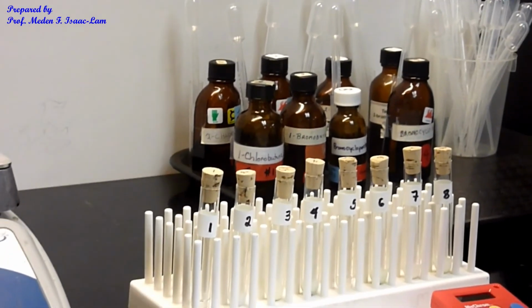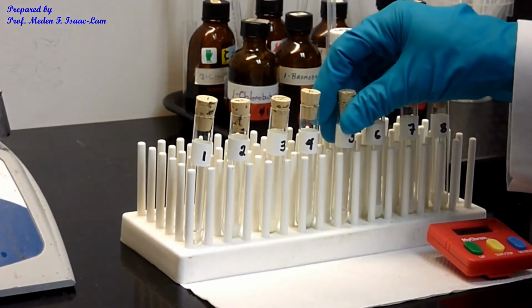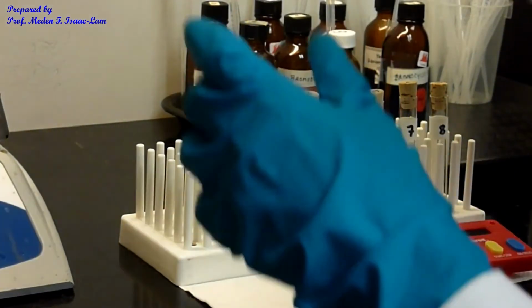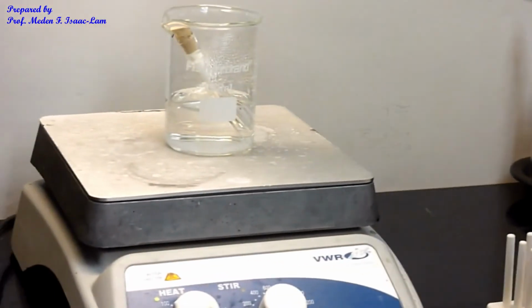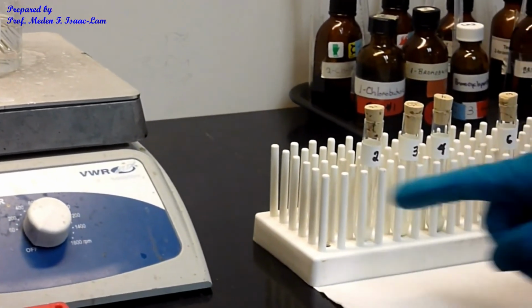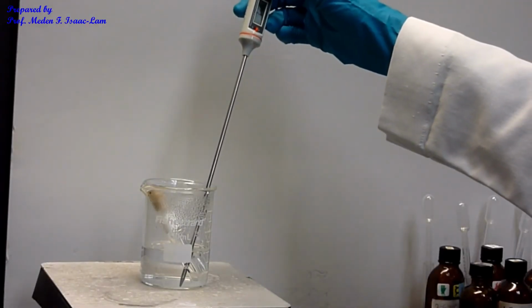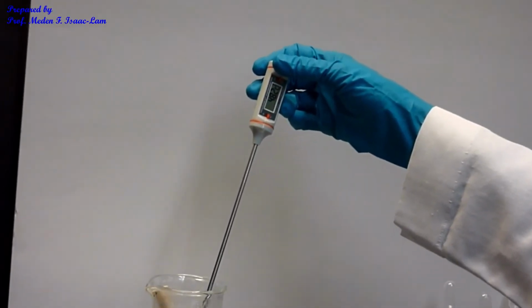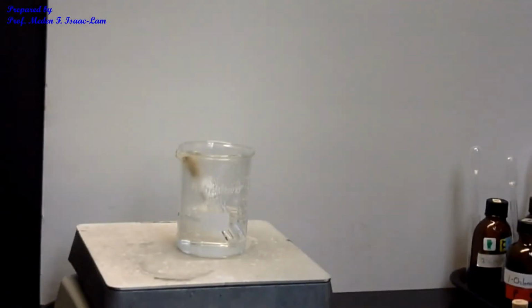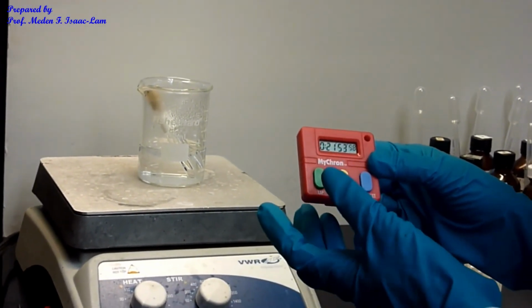And then we're gonna stick this once it's about 16 minutes already. So I think we're gonna stick these in the water bath, okay, for 5 minutes, and then we'll compare. So total basically would be 20 minutes, but I heated up 1 and 5 for 5 minutes. So I'm just measuring the temperature of the water bath, and it's almost 49. So I've been heating it for more than 5 minutes. So the time that we started for sample 1 is now about 22 minutes.